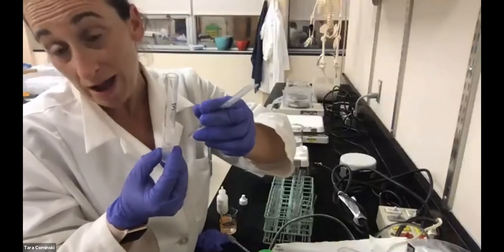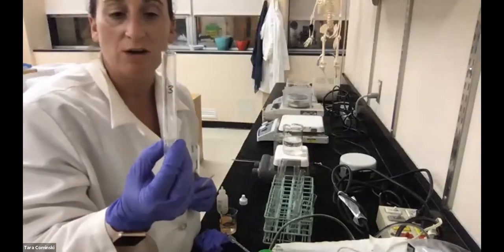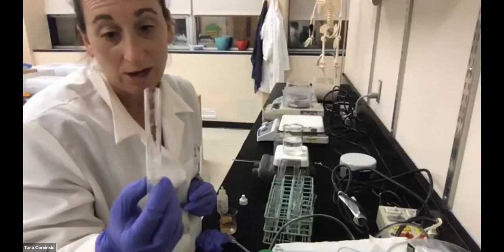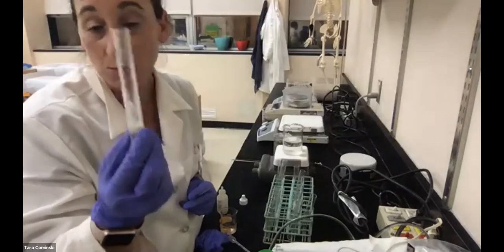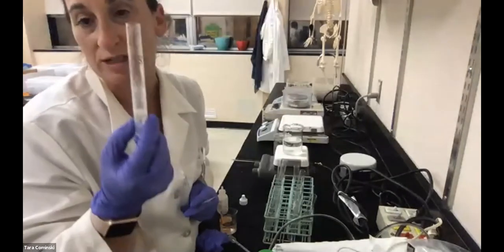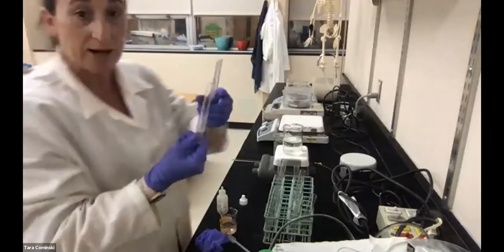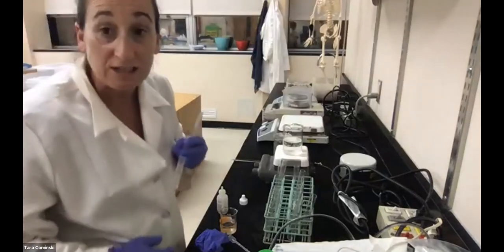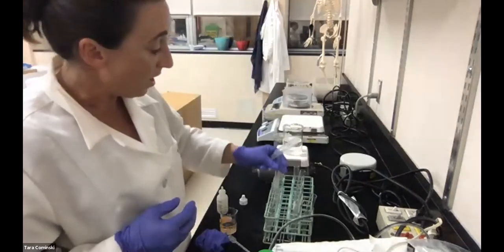Again, think about why. When we think about the effect of temperature on proteins or enzymes in general, if we denature the enzyme at 100 degrees, it loses its function completely. And as you could see, there were no bubbles. The reaction was not able to occur because we basically damaged or denatured the enzyme. So that was tube 3. Again, we were on page 60, so this is the effect of temperature, tube 3, 0 millimeters.